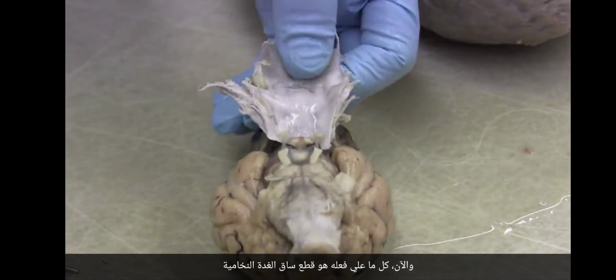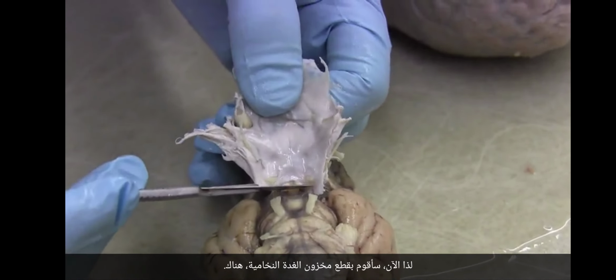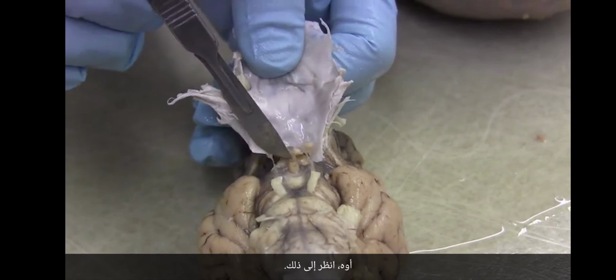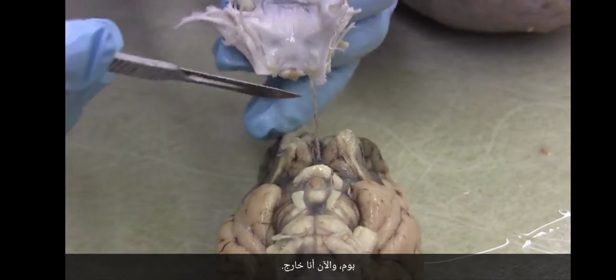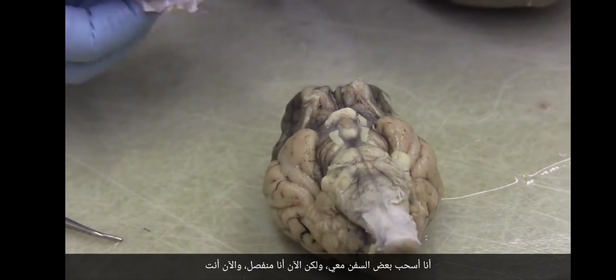And now all I have to do is cut the stalk of the pituitary. So now I'm going to cut the stalk of the pituitary right there. Ooh, look at that. There's the stalk of the pituitary. That's very cool. Boom. And now I'm off. I'm dragging some vessels with me, but now I'm separated.